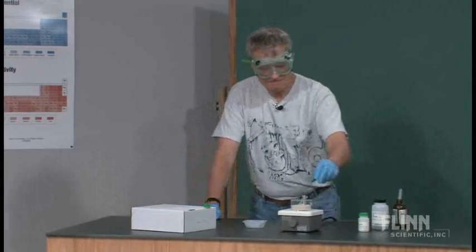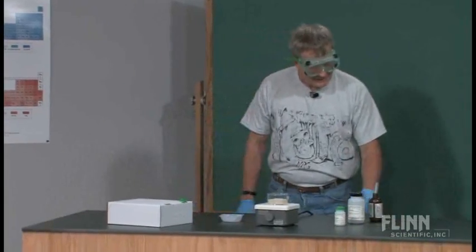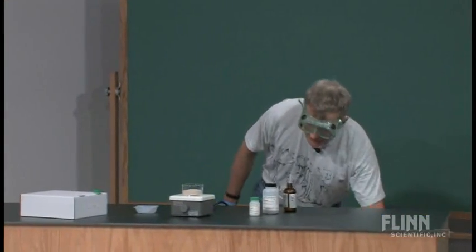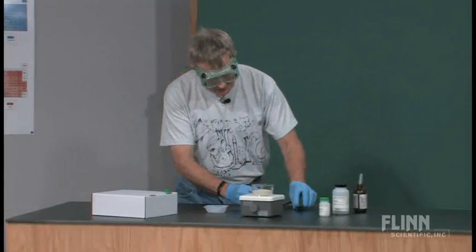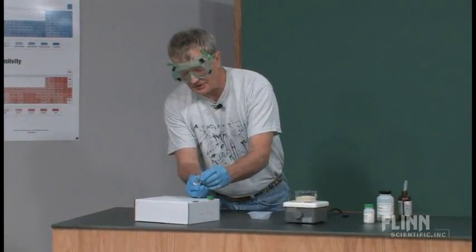When you get done, and here we go to the Julia Child moment, and when you are finished, your product will come out looking like this. And if you pull it back out, you'll get something that looks a little bit like this.